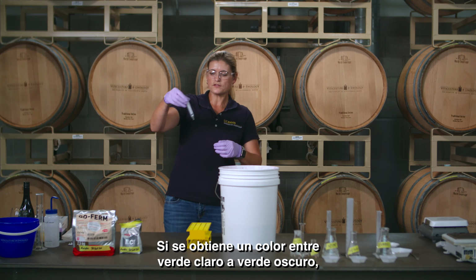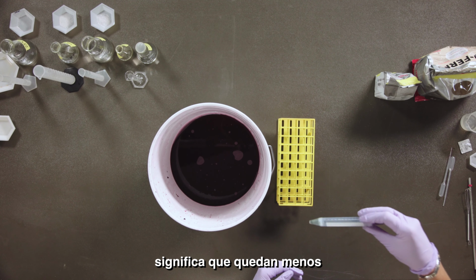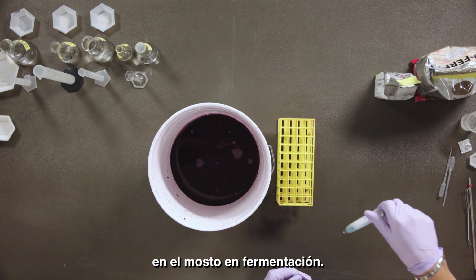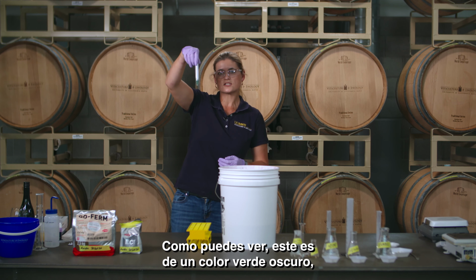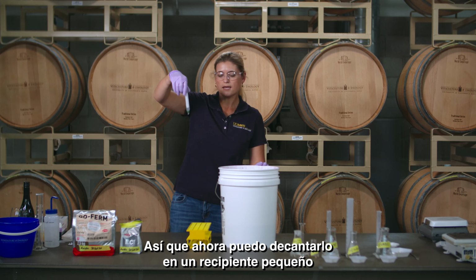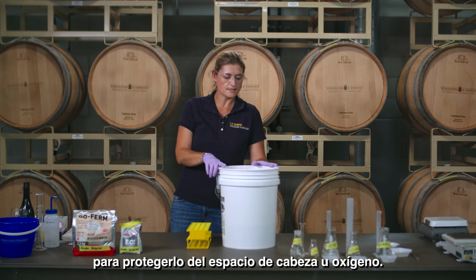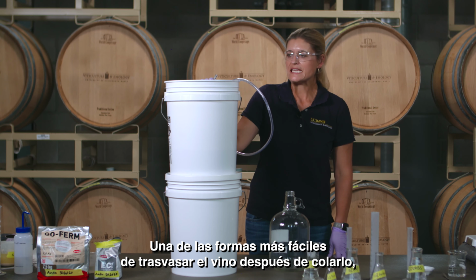Now, if it gives you a light green to dark green color, then it means that you have less than 2 grams per liter of sugar left in your fermenting must, or then wine. As you can see, this is a darkish green color, which tells me that my wine is dry. So I can now decant this over into a smaller container to protect it against headspace and to settle the wine.